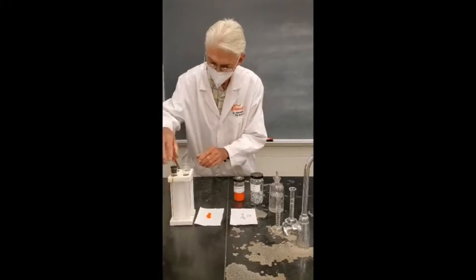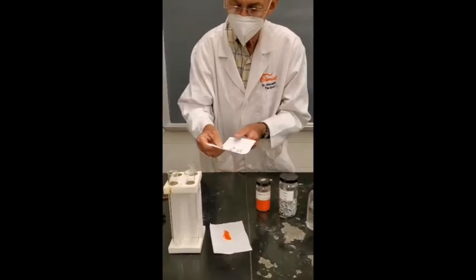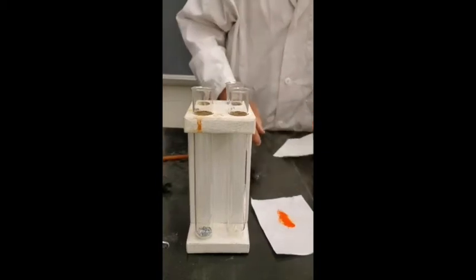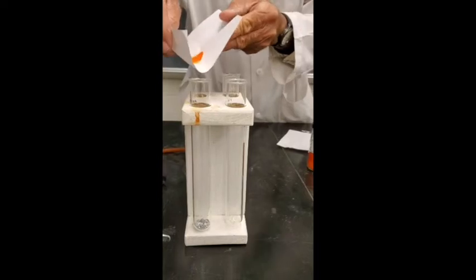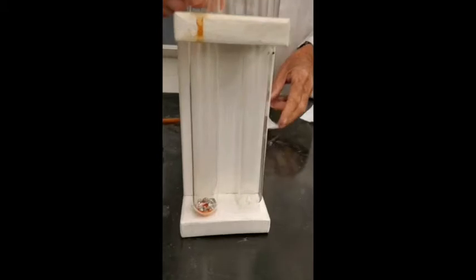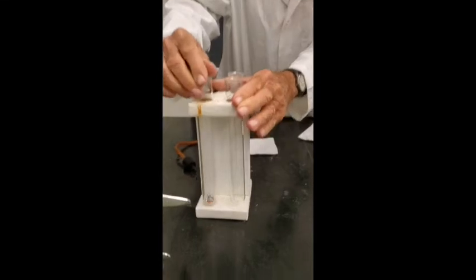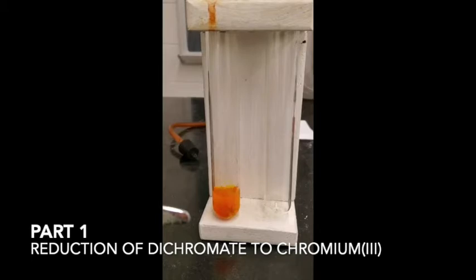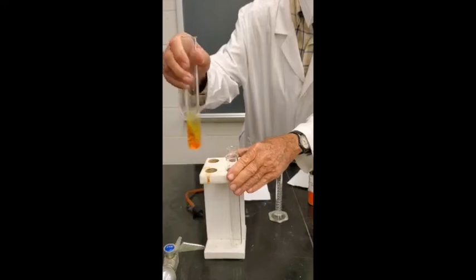Get this thing going. So what I'll do is I'll put the zinc in here. And then we'll put in the dichromate. And then we'll add some water to it. Let's just mix it up a little bit. Ready? I'm adding 8 milliliters of water. And the dichromate is soluble in the water. Let me mix it up a little bit.